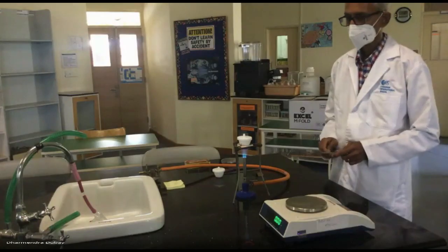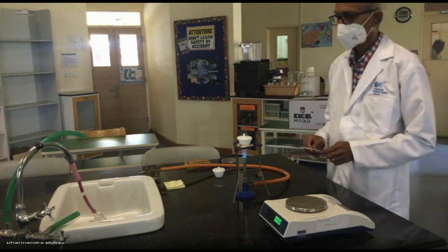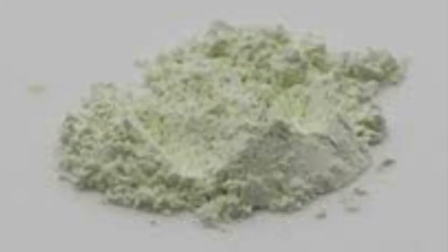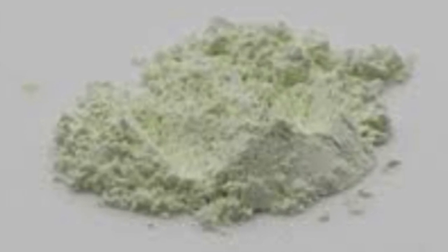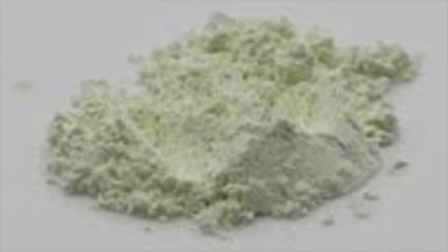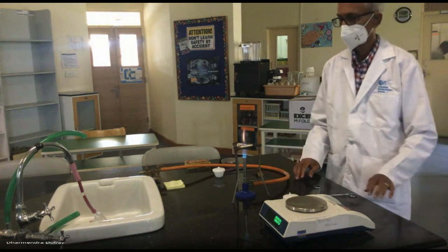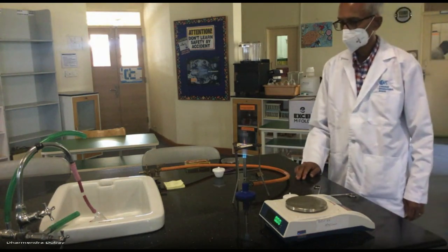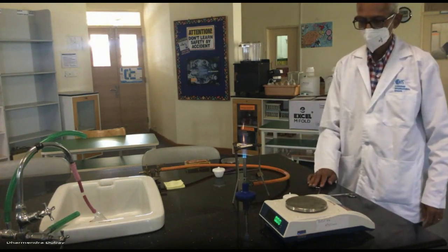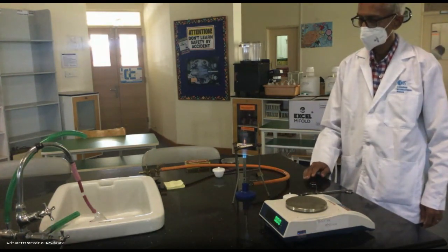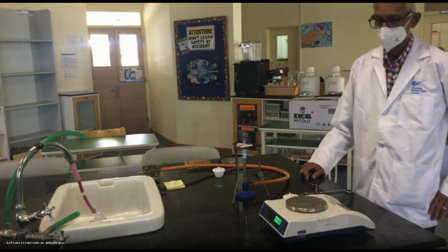Magnesium oxide is white. Magnesium oxide is a very clean looking white, like Mr. Ranjan's lab coat. And what about magnesium nitride? It's a yellow color. Greenish yellow. Yes, it says magnesium nitride is commonly described as yellow. But it's definitely not white. So it's going to, in a small amount, be mixed with something that should be pure white. So if we don't get pure white, that could be one reason why. There could be another thing. There could be some unburnt magnesium in there that didn't completely combust. And it's still there as a grayish looking thing. But let's have a look then.